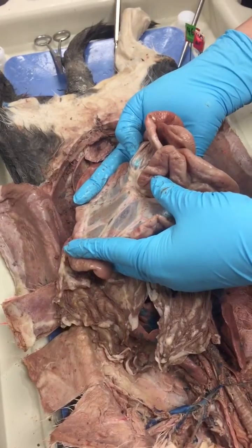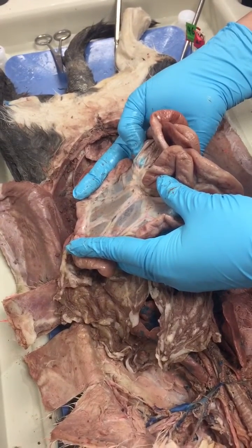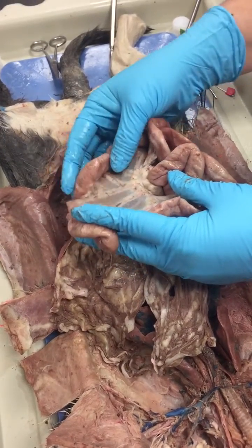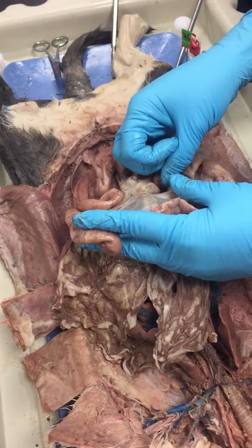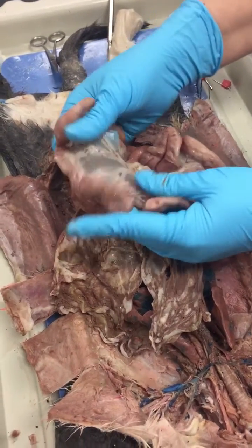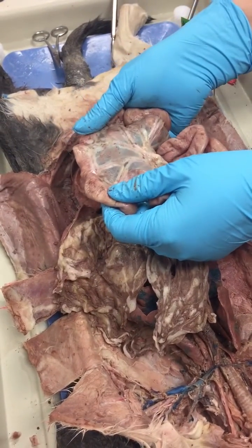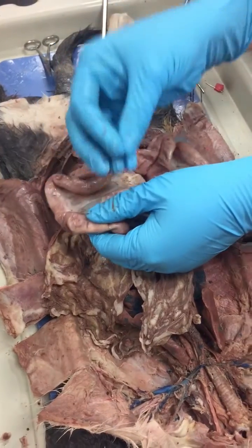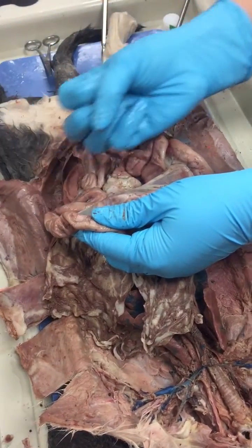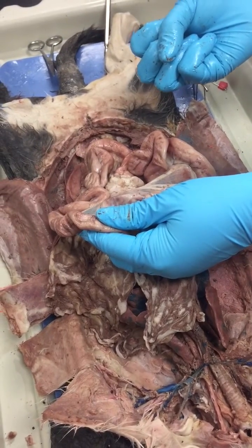This contains your lymphatics and those capillaries that are going to absorb all the nutrients from the ileum and the jejunum. And so look at that, people. Is it cool or is it cool that the capillaries are right next to the place from where it's going to absorb all the nutrients?